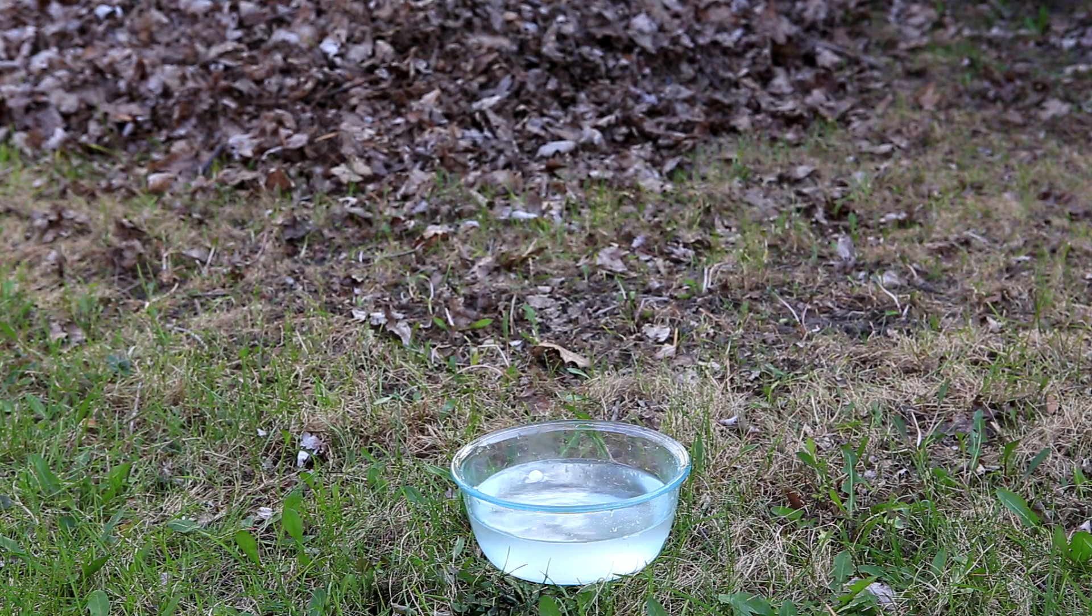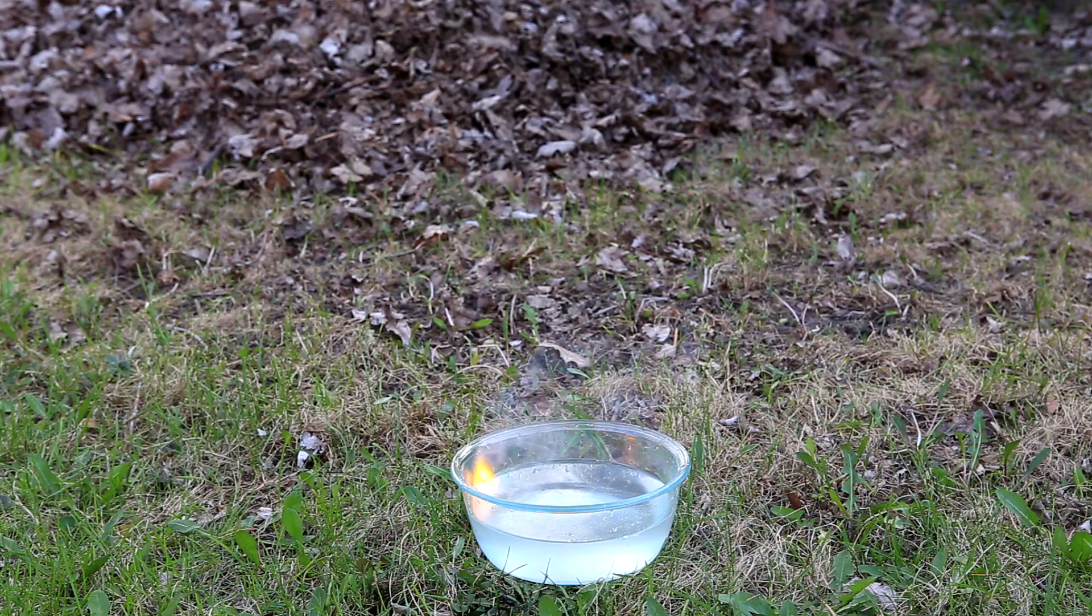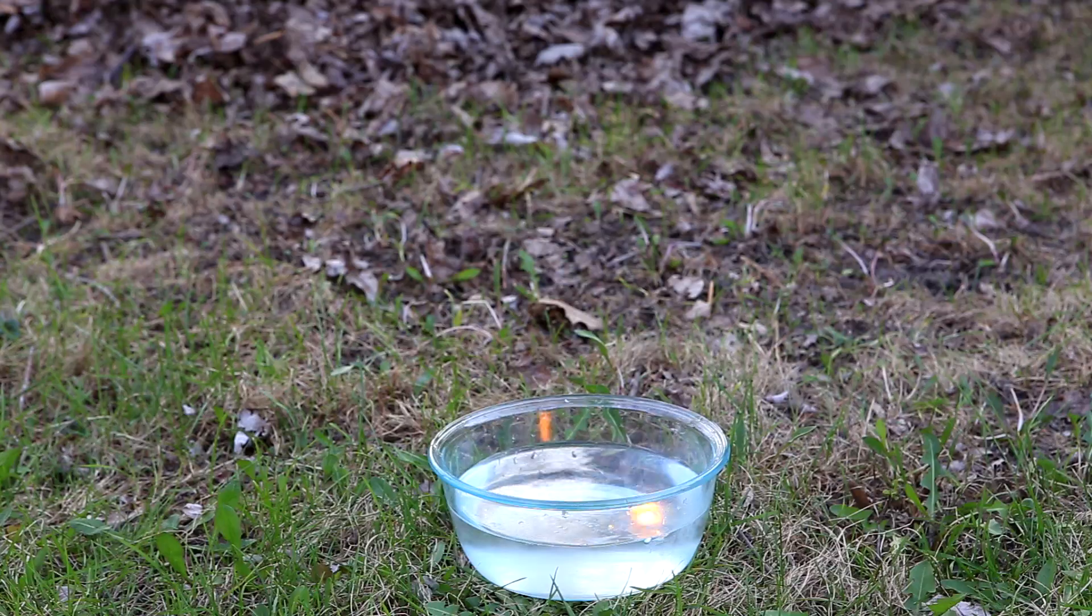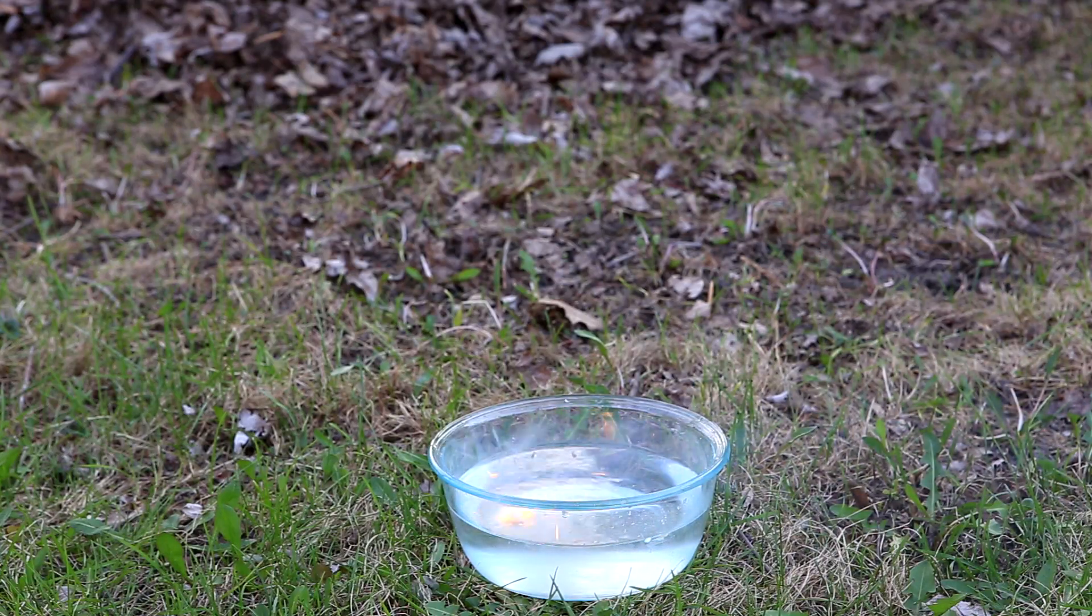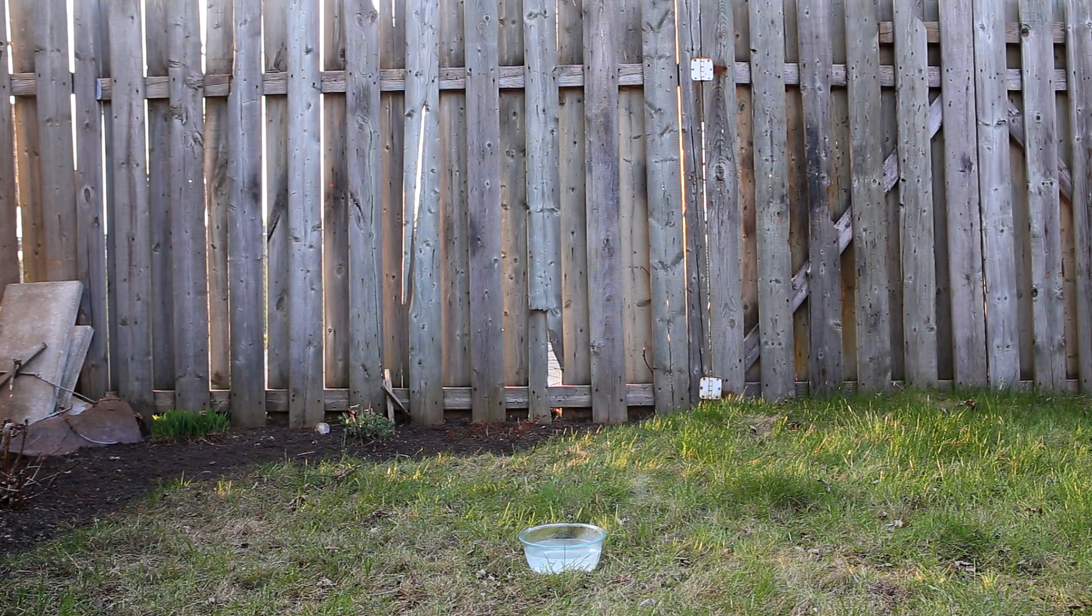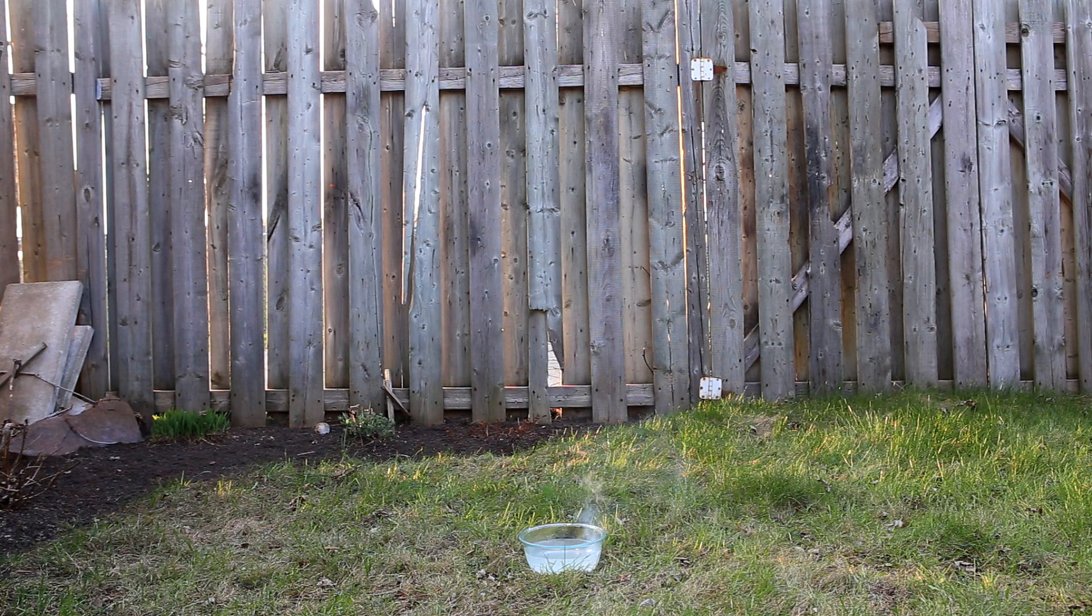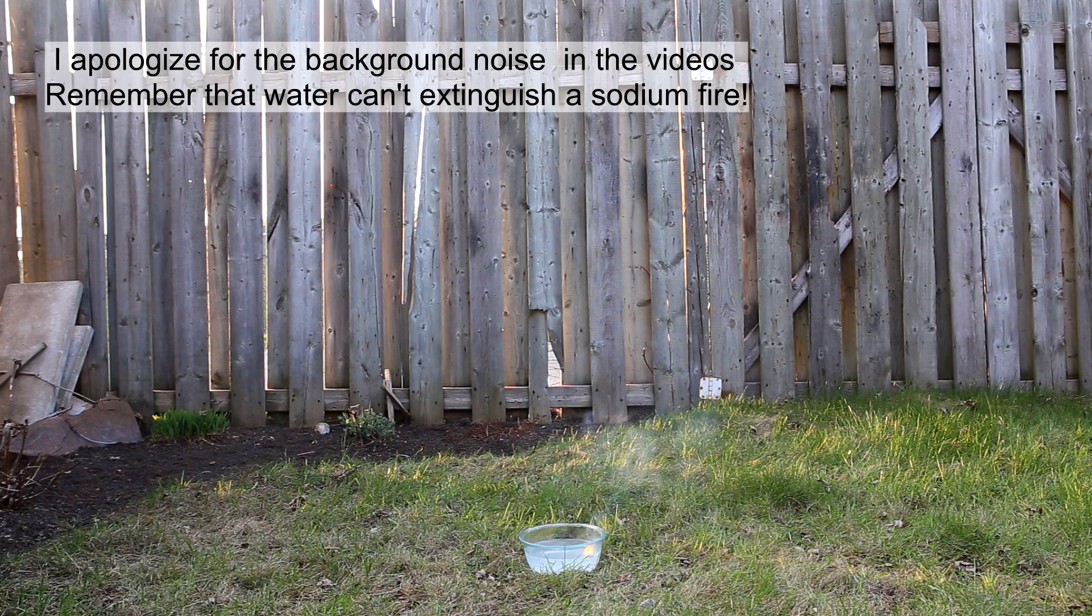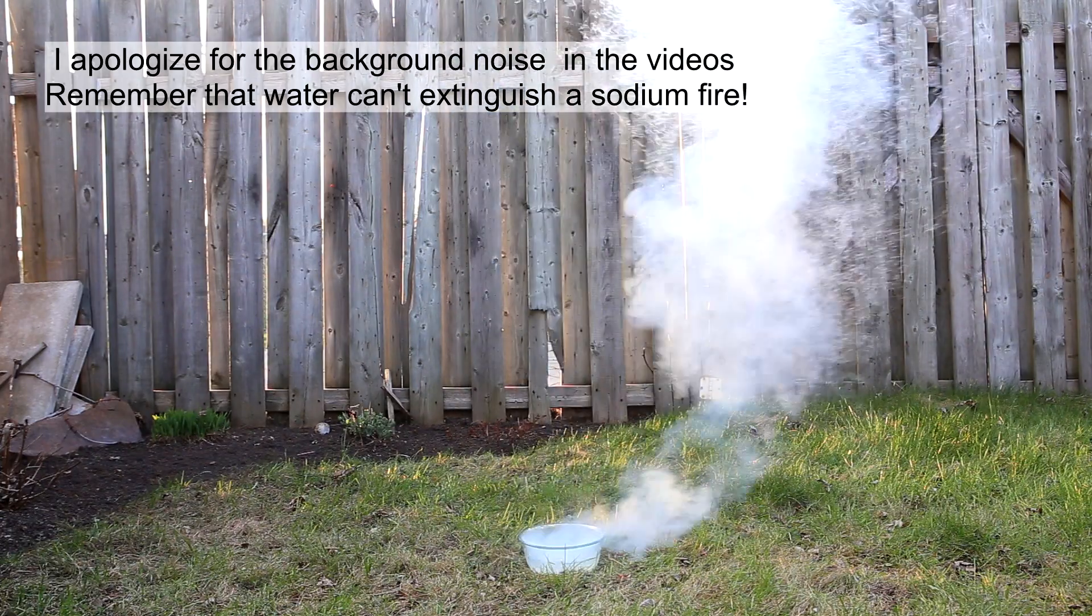Now we will see some reactions of sodium with water. The reactions are in general quite variable, and sometimes it can explode and other times it won't. Sometimes it'll just sputter and fire flaming sodium all around. What's interesting is that the mechanism by which the sodium causes an explosion was only recently discovered. The following are three videos of about a gram of sodium reacting with water with the original sound.